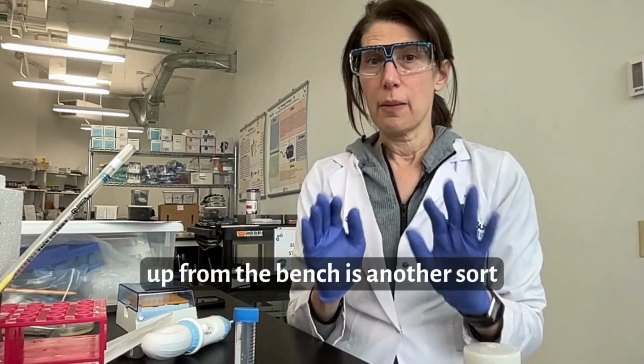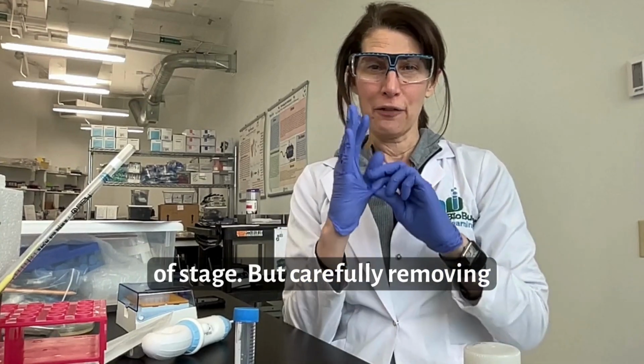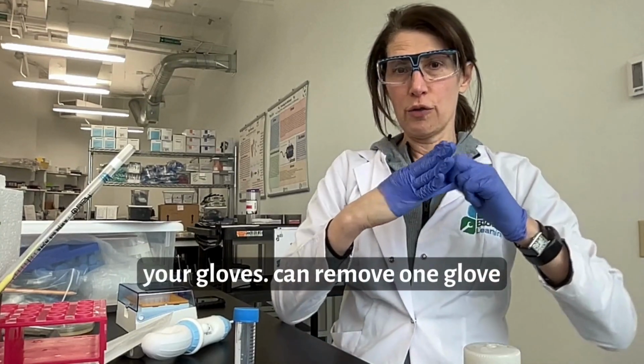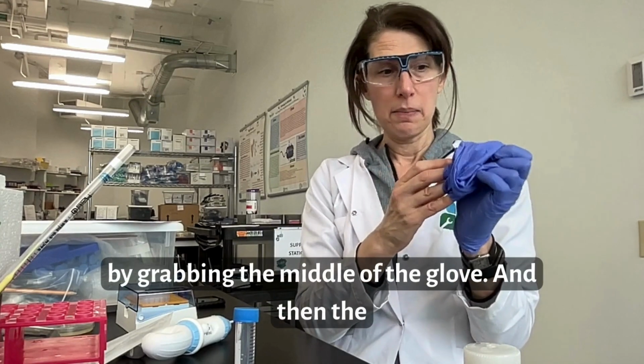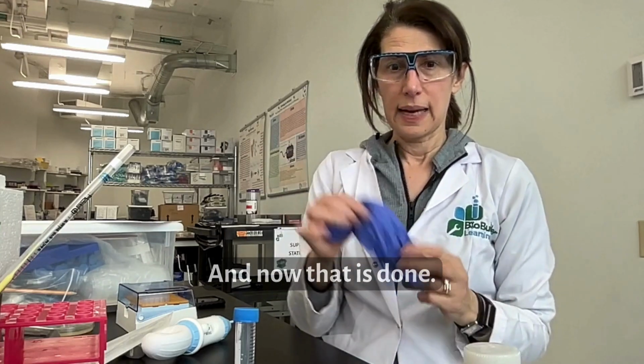Cleaning up from the bench is another sort of stage, but carefully removing your gloves. You can remove one glove by grabbing the middle of the glove, and then the second glove by putting your finger under the lip, and now that is done.